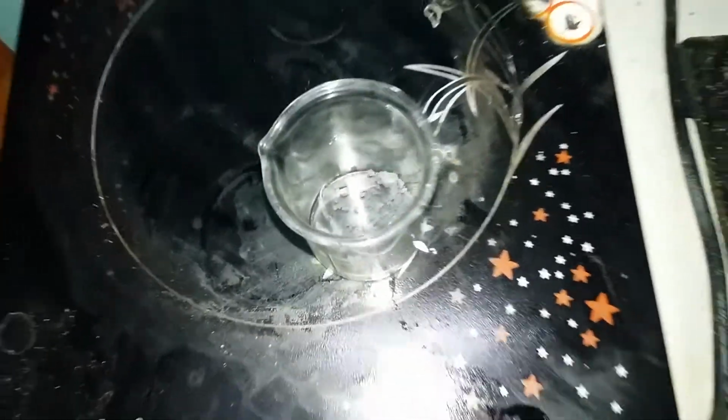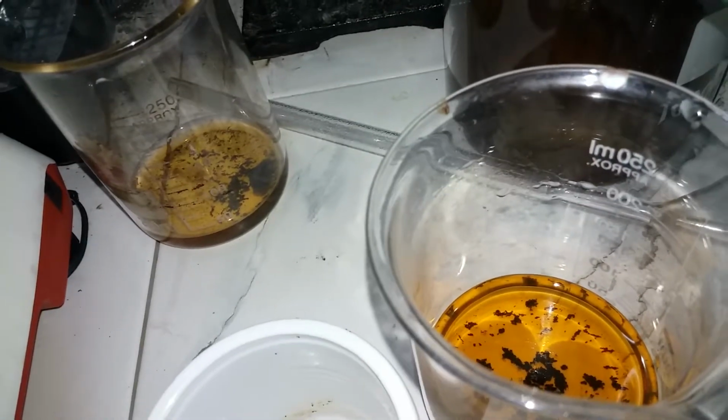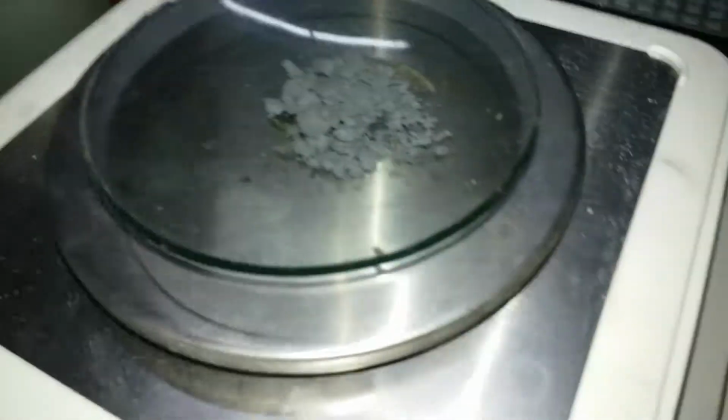So what we're gonna do is use sublimation, but it does not actually sublime. What happens is it melts and I would say boils, evaporates, I guess that would be the nicer term. So I'll show you why, because in school we have learned that iodine sublimes, it does not have a liquid phase. So I'm gonna turn on the power and we're gonna wait. Meanwhile, we're just gonna transfer this to our vial.